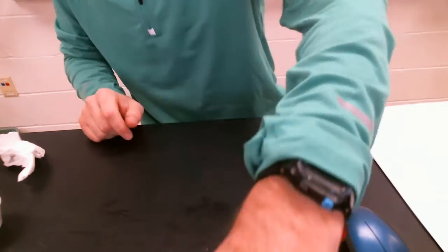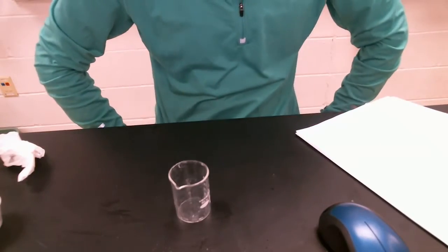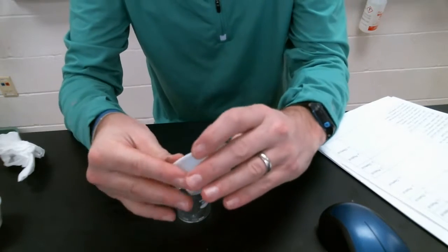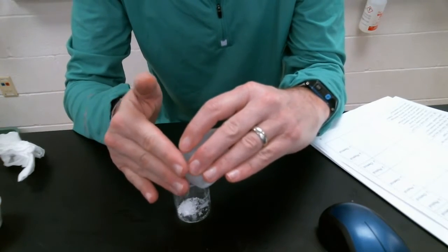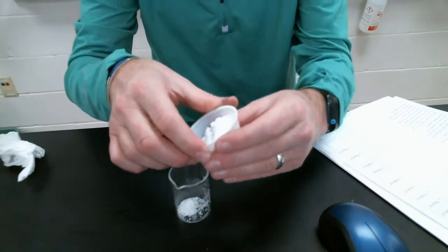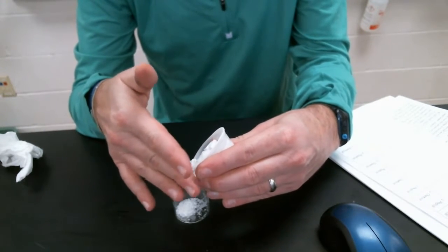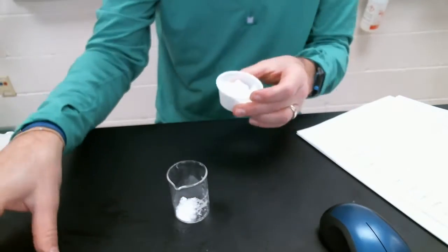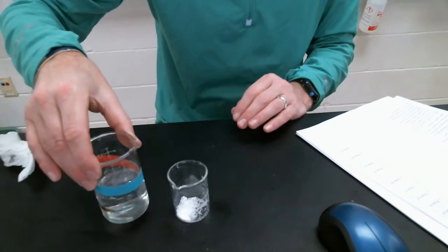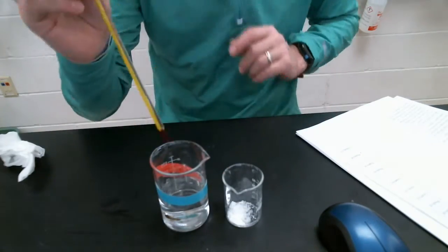Okay. Another small beaker. Number 4. No, number 5. We're on number 5 already. Okay, I need a small scoop of some citric acid. I'm just going to ballpark this. Some citric acid. And then I need some sodium bicarbonate, which is also baking soda. And I'm being so scientific about this. There we go. And now I need a separate beaker with some dihydrogen monoxide, basically water. So I got my 2 white powders, I got some water.